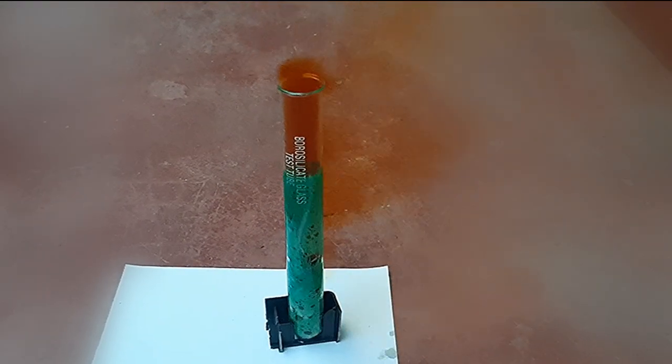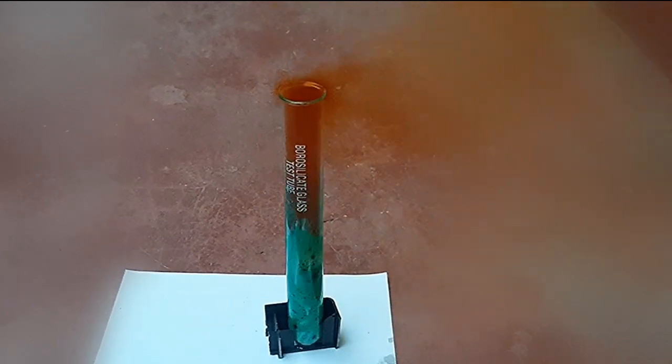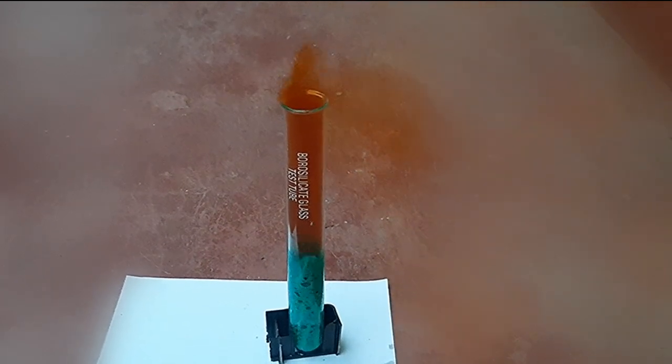Oh wow guys, please don't try this at home. It's kind of dangerous. The blue color is from copper nitrate.